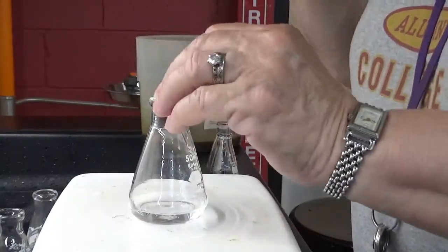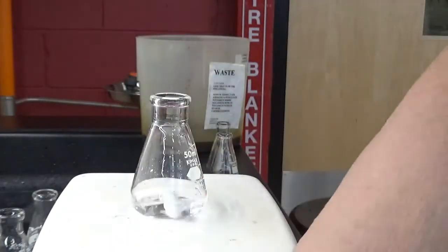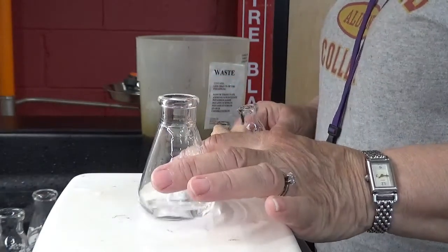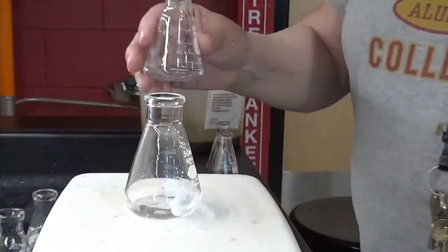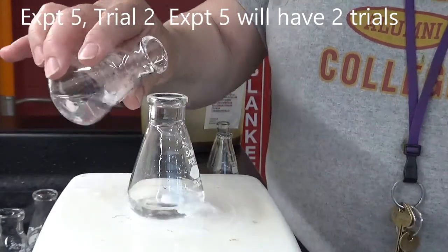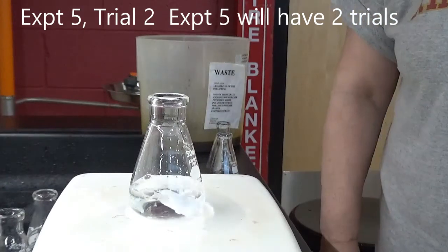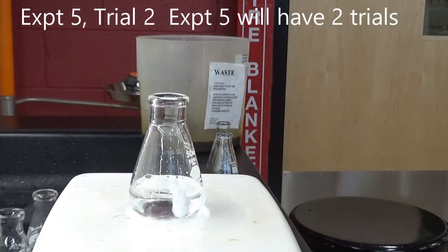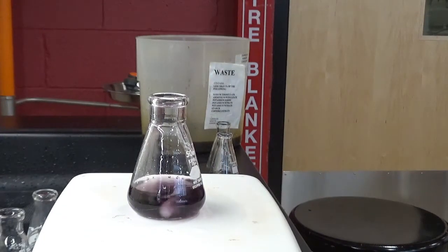Solution A. Sometimes it's just the shape of the bottom of the flask that does that. Okay, let's go. Okay, done.